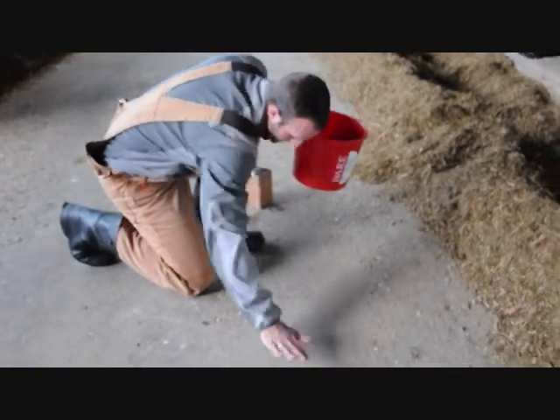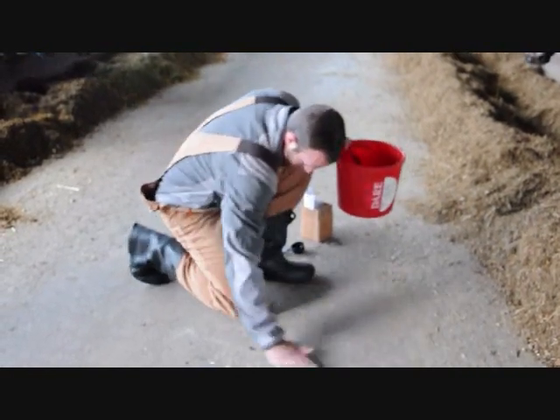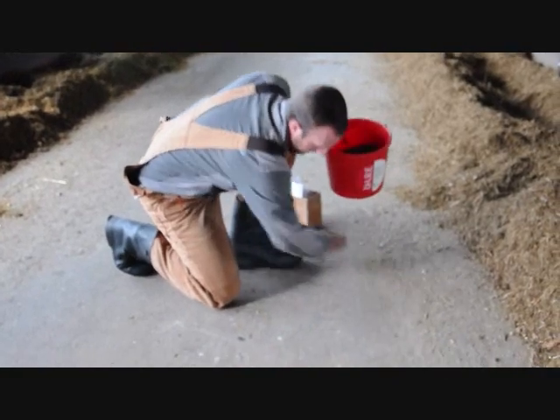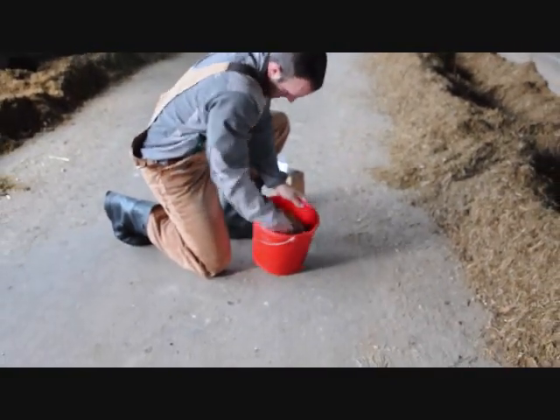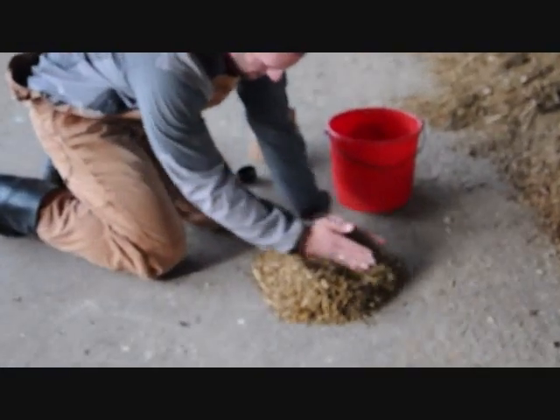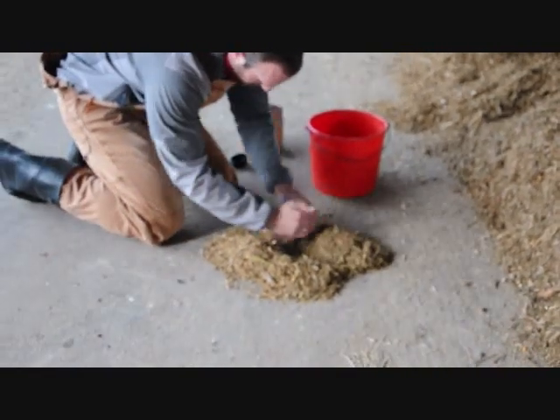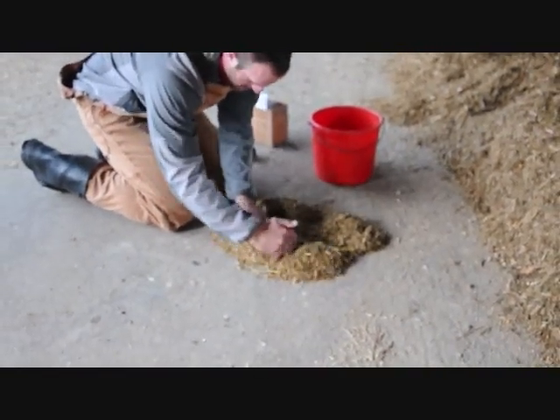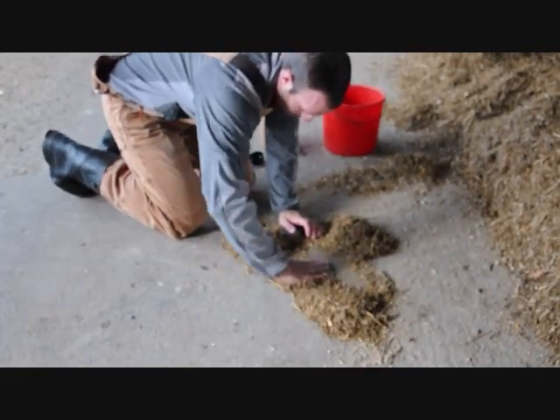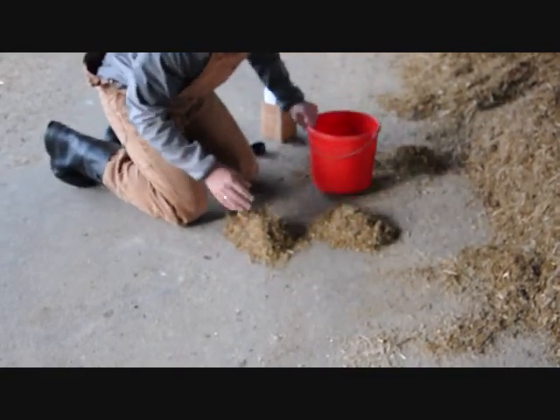For the mixing and quartering technique, either on a piece of plastic or a spot of clean concrete, we'll get our five samples down to a subsample of about one pound that we'll then send into the laboratory. Dump the sample out, split the sample roughly in half, split the subsamples in half again and discard one quarter and one quarter. So we're throwing half the sample out. We mixed and quartered.